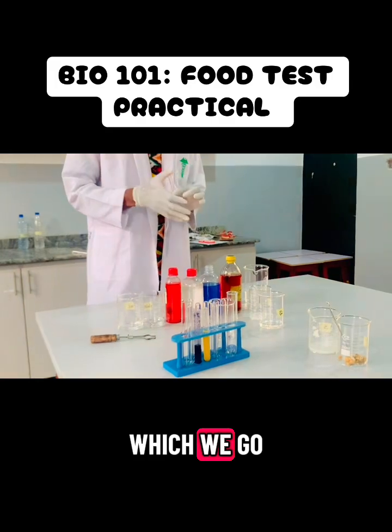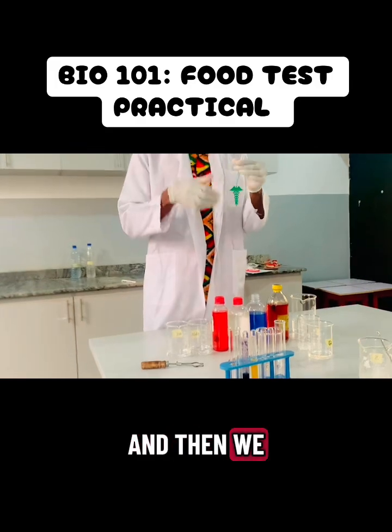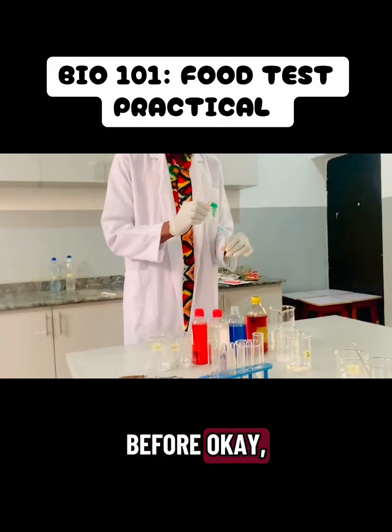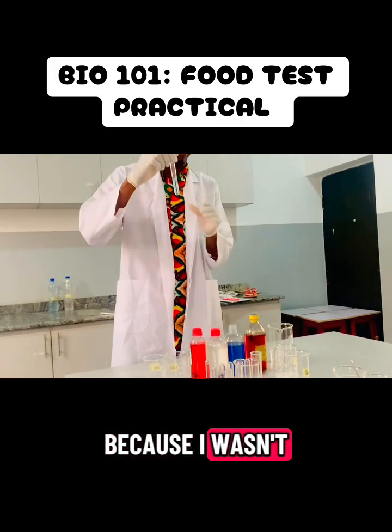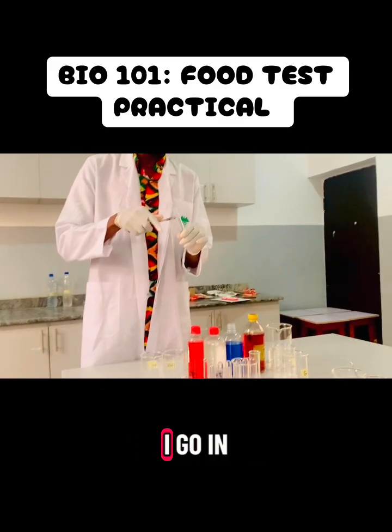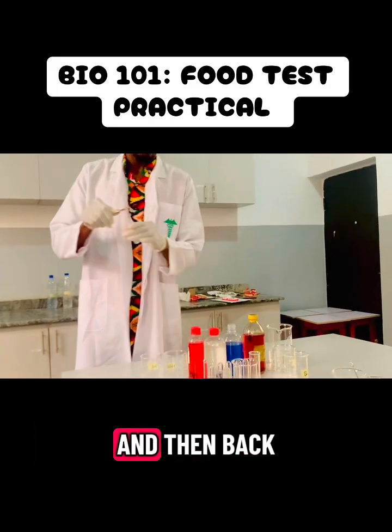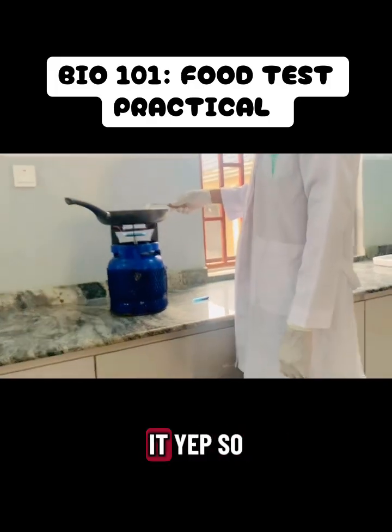After which we mix, just shake thoroughly, and then heat like before. Here you can see that I added more because I wasn't convinced that the drop I added was enough. So I go in with my test tube holder, properly fitted, and then back to the hot bath.